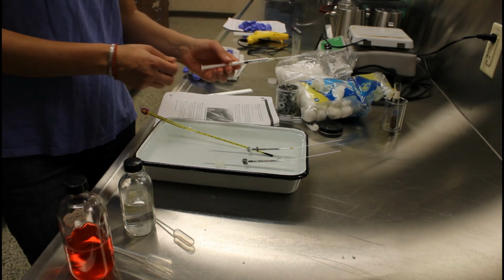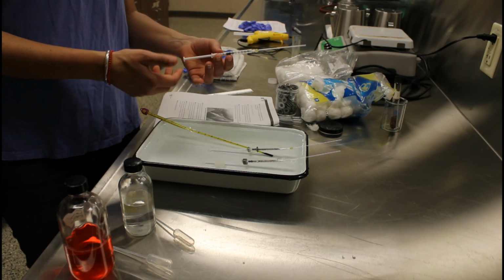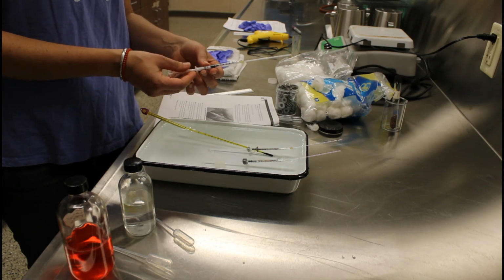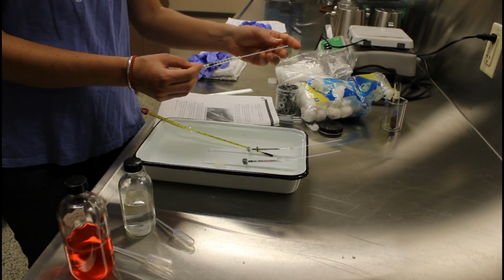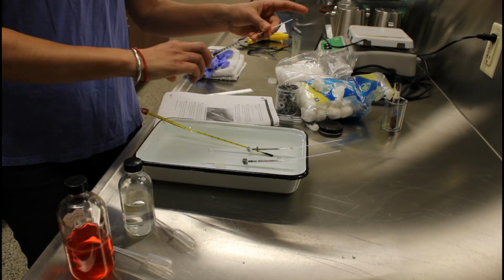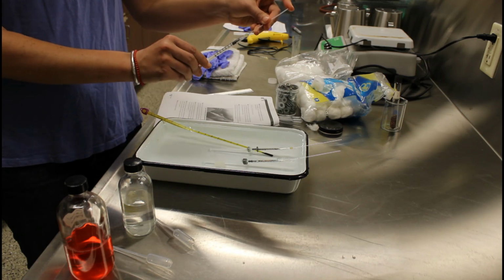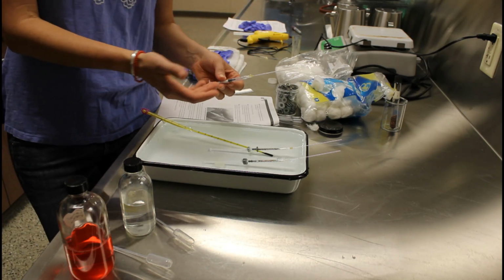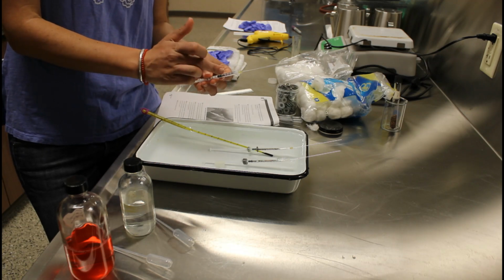All right, so in this activity, we are going to measure cellular respiration. And to measure cellular respiration, we're going to construct these little micro respirometers. I've already taken a 1 milliliter syringe and glued a small diameter capillary tube to the end. I can tell that this is airtight because when I pull back on the plunger, it kind of sucks it up a little bit. See? So we need this to be airtight because we're going to be measuring the consumption of oxygen within this chamber.